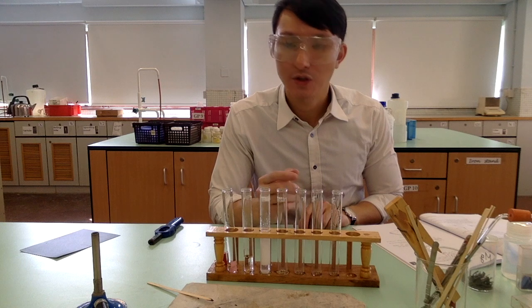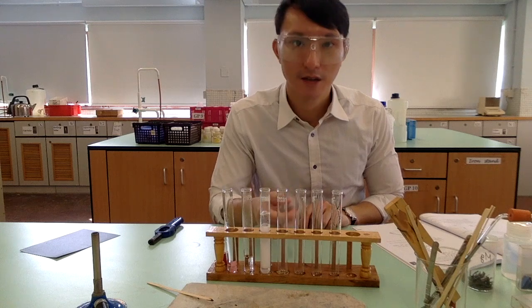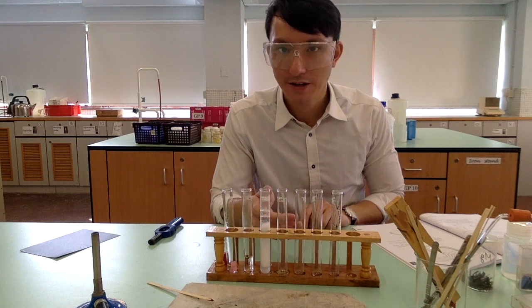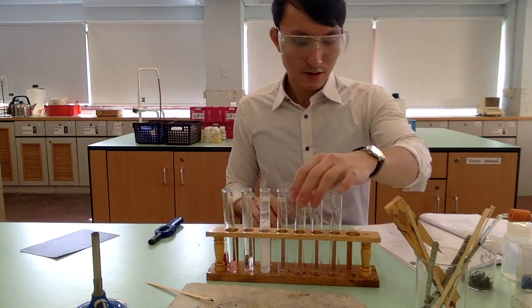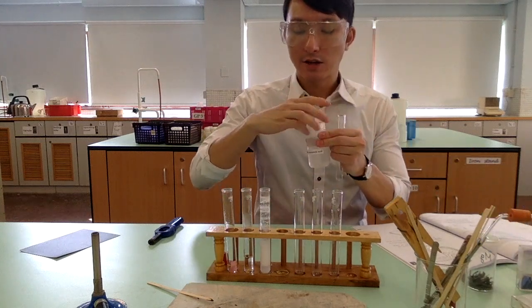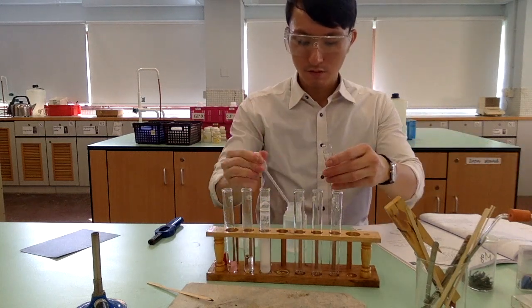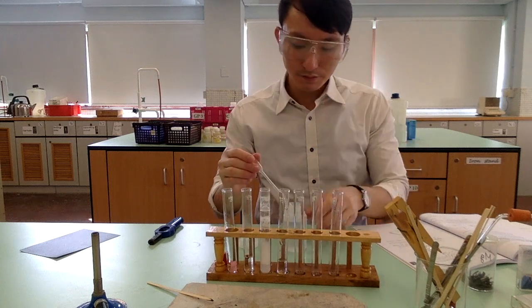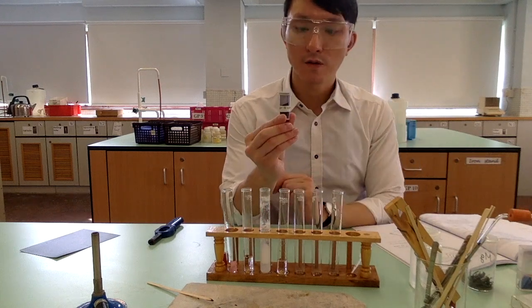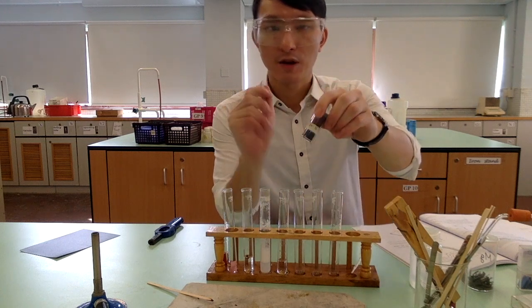And this time, we are going to use copper 2 oxide as an example, as well as calcium hydroxide as an example. We want to see the reaction between this oxide and hydroxide with hydrochloric acid. So first of all, I will get a test tube, and then to that I'm going to add again 2 pumps measure of hydrochloric acid. And then I will add 1/4 of a spatula of copper 2 oxide. Pay attention that copper 2 oxide is a black solid.